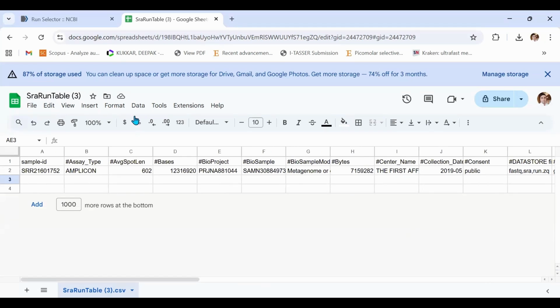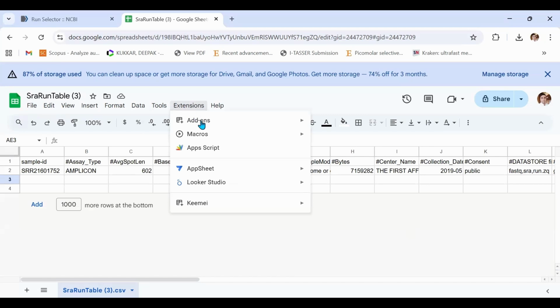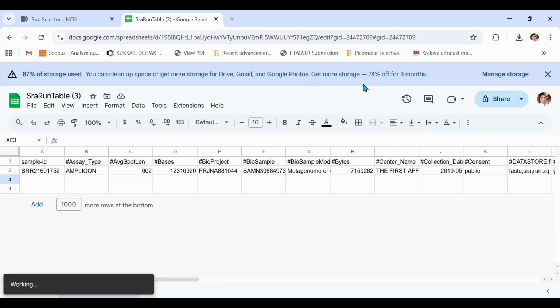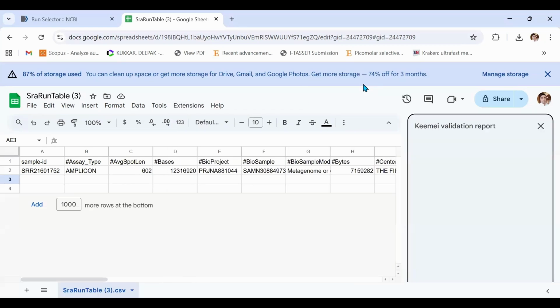Once you have done that, just click on this extensions button. Once you click on this extensions button, a drop down menu will open up. Right at the bottom you will see the option called KEEMEI. Once you click on KEEMEI, you will see another drop down box, and in this drop down box select validate QIIME2 metadata file, and you will see it is going to provide a validation report. You can see that the validation report says: good news, this sheet, this CSV, is a valid QIIME2 metadata file. You can simply now close it.